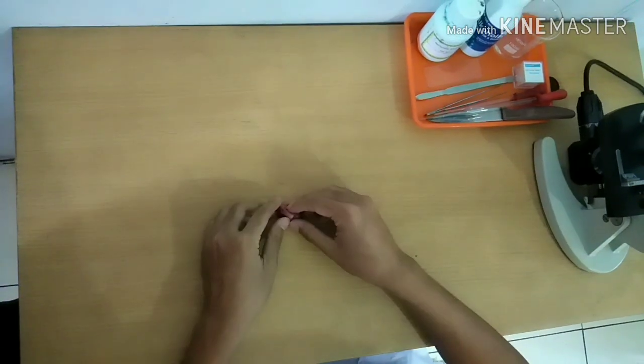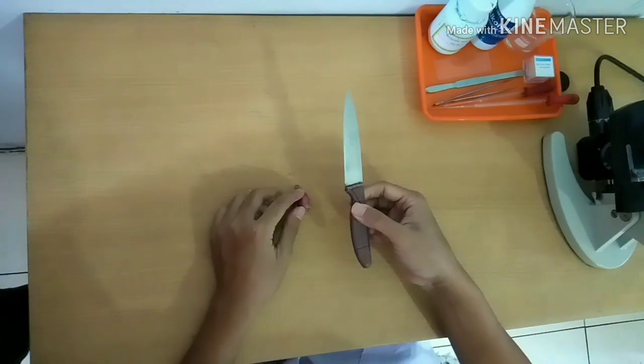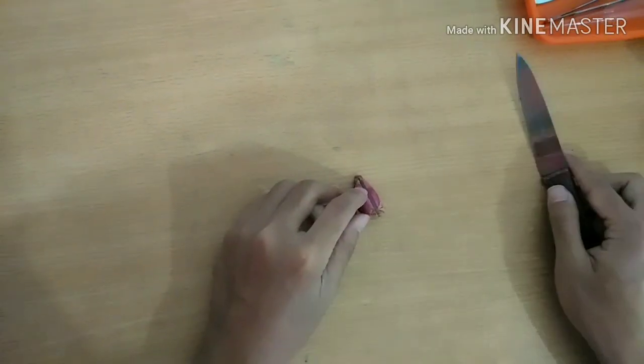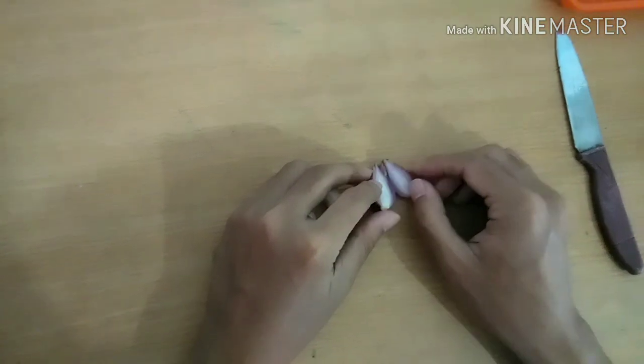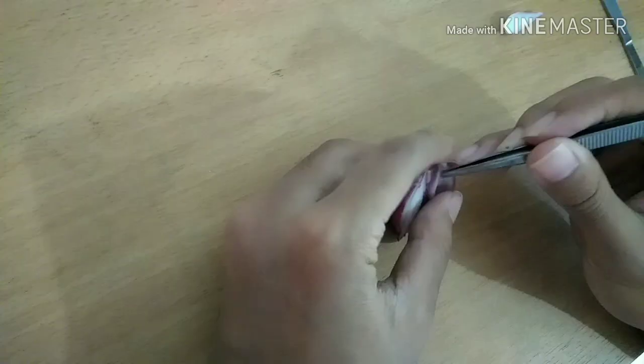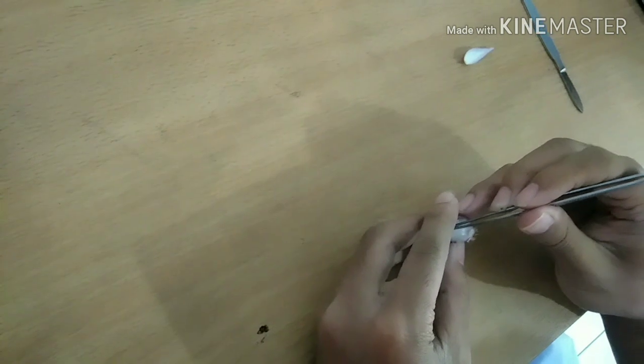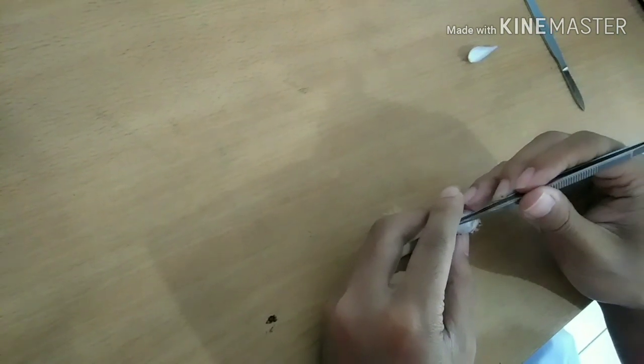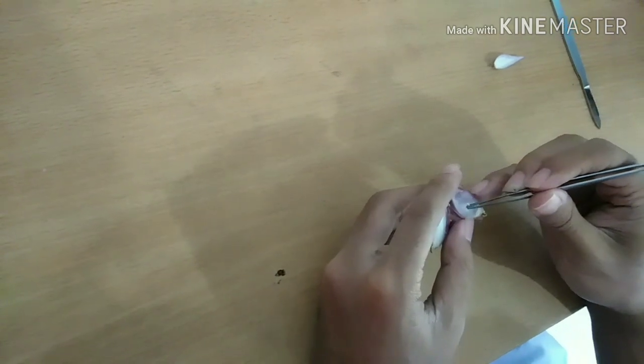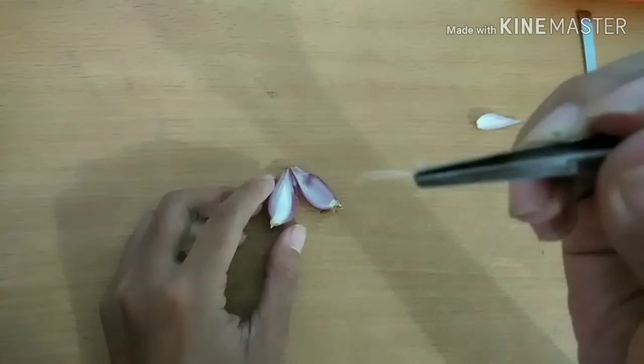Okay, the first step is one, slice the onion in two parts and then take the membrane inside the onion. Two, put the membrane on the object glass.